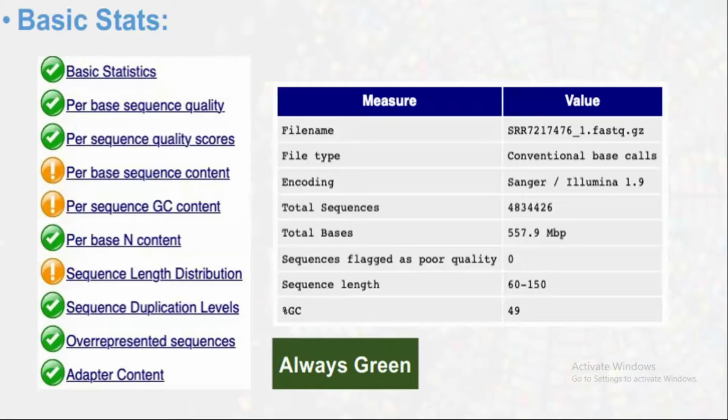So basically this is the report, and the percentage of GC content is 49%. It should be 50%, but 49% is okay. This is all the statistics of my FastQC report, and it is always green. Now we will proceed with the per base sequence quality.